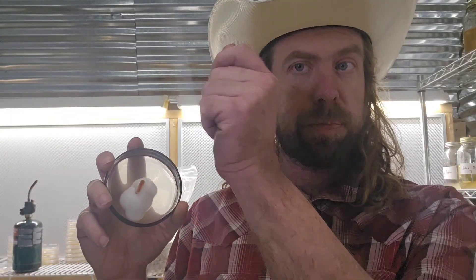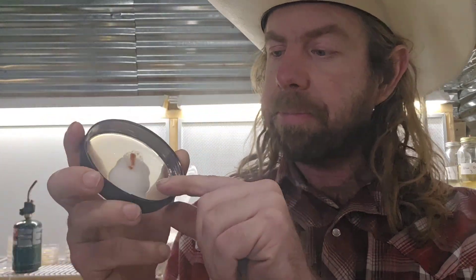This is how I'm going to approach using these and breeding with them — it's experimental, but I think we're going to have really good results. This is how I created previous strains, like my lion's mane Samson strain — I did a spore swab of the fruit body, streaked plates, collected multi-spore sections, and put those onto new plates and then to grain jars. I actually did 100 jars to create the Samson strain, selecting it from 100 different multi-spore inoculations.